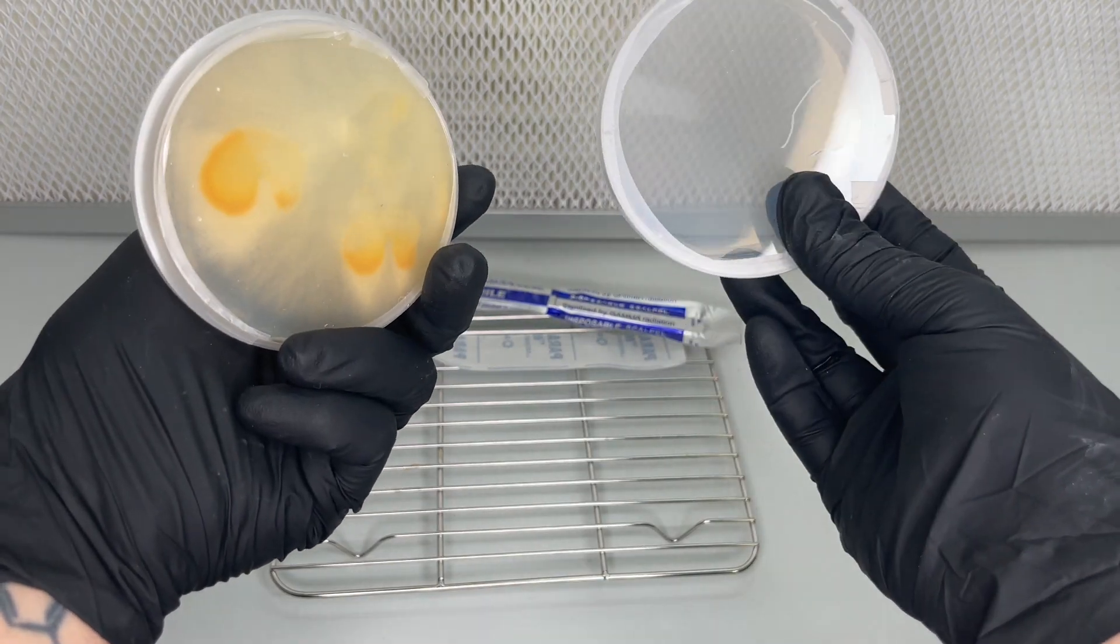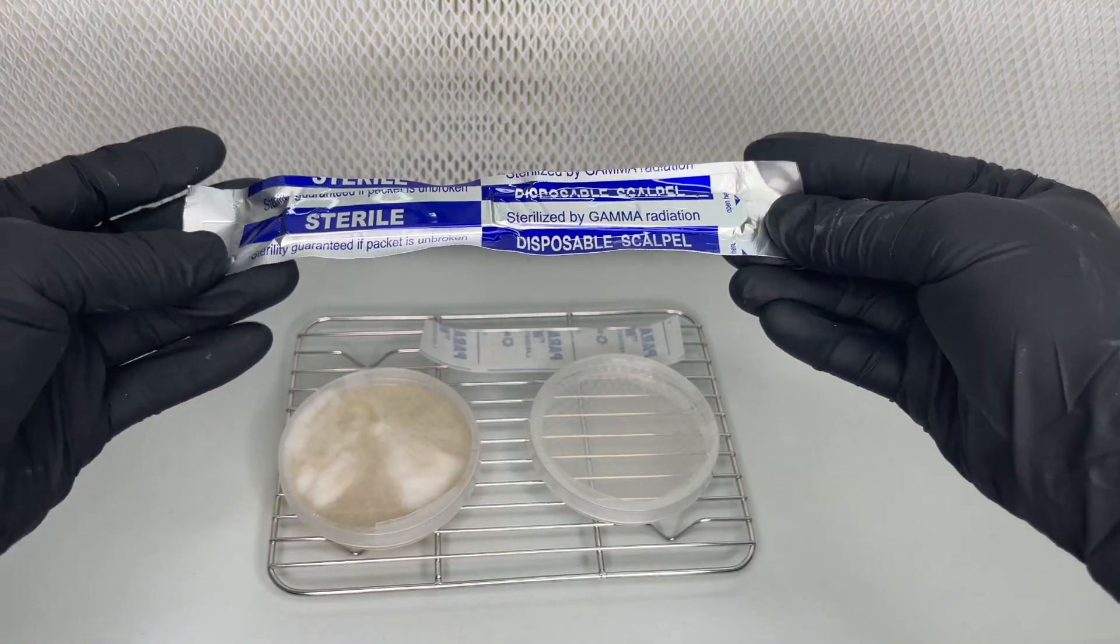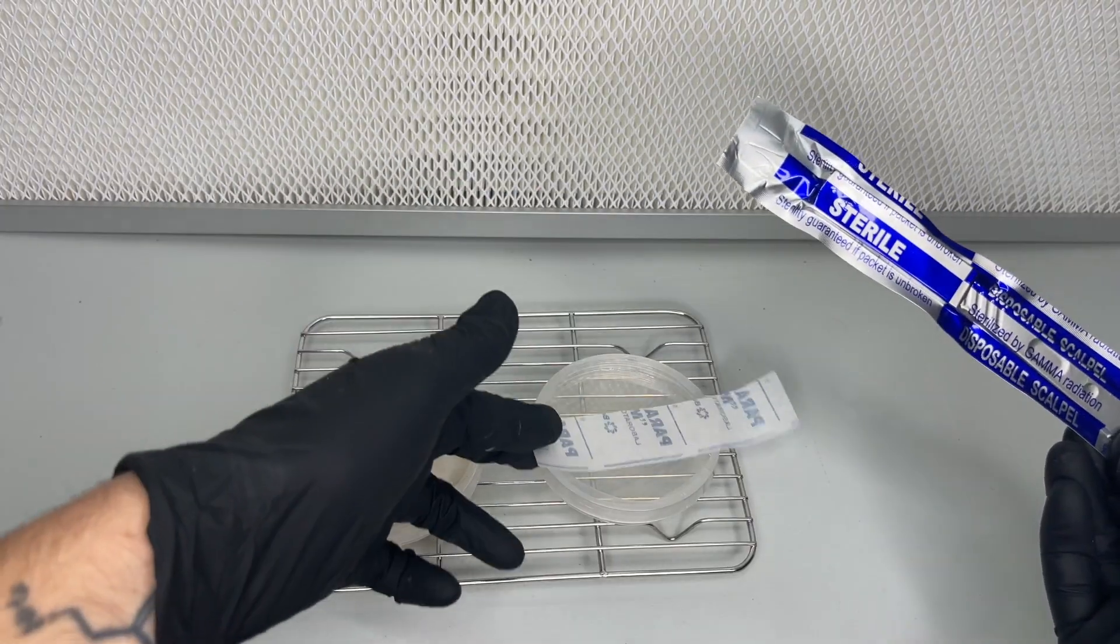I was testing some liquid culture on agar and this orange bacteria started growing right away, and then the mycelium would grow over top of it.